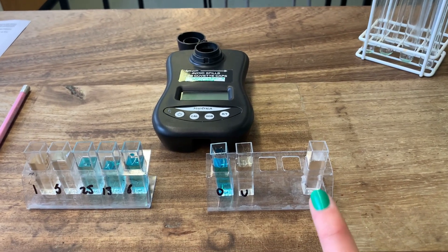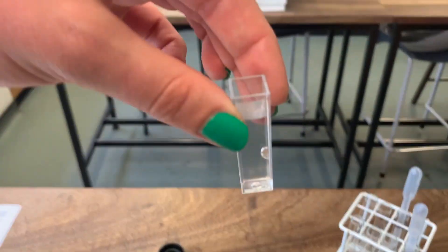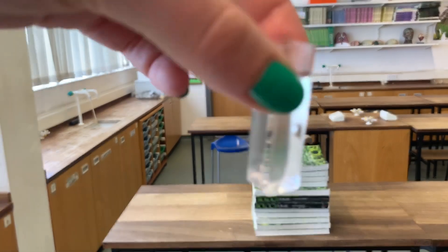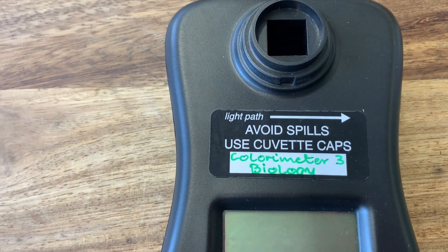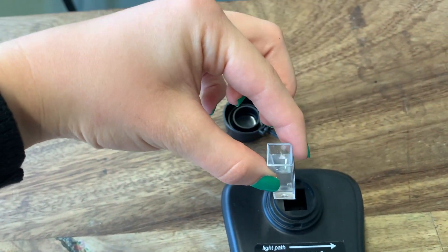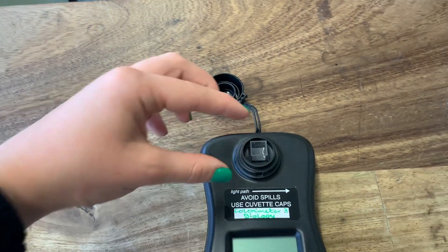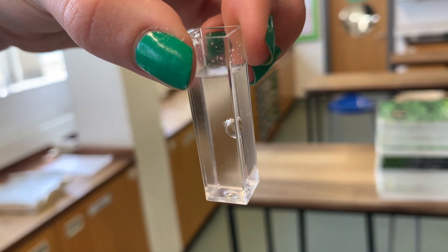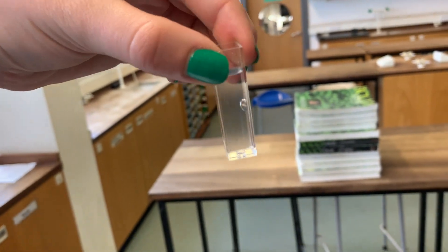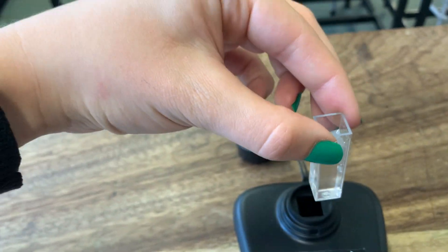The distilled water cuvette needs to go in first to calibrate the colorimeter. You can see that cuvettes have a slightly frosted side and a clear side. Check your colorimeter - it tells you which way the light path goes, so make sure the clear sides align with where the light will pass through. Also watch for little bubbles, as they can affect the light passing through - just give it a gentle tap on the bench to get rid of them. You also don't want the cuvette scratched or wet on the outside, as that will affect how light is able to pass through.